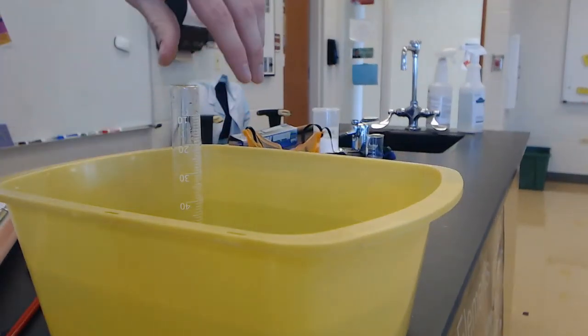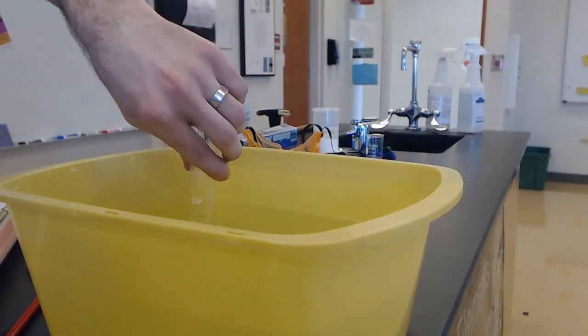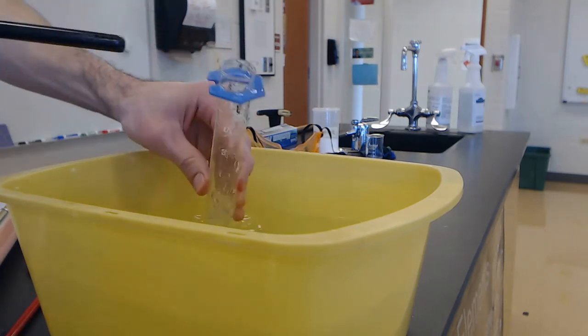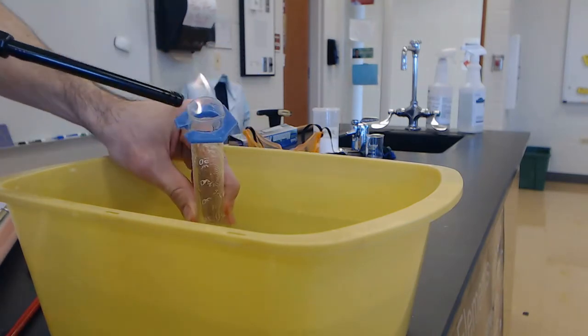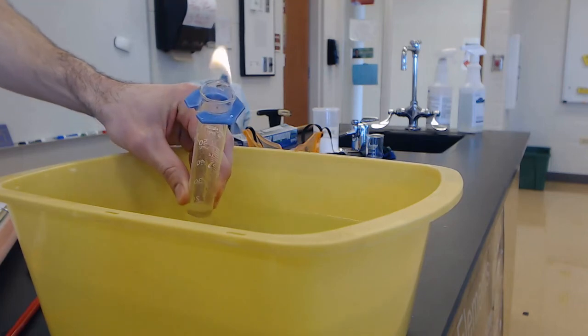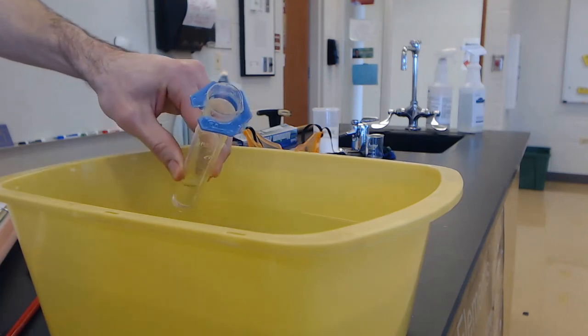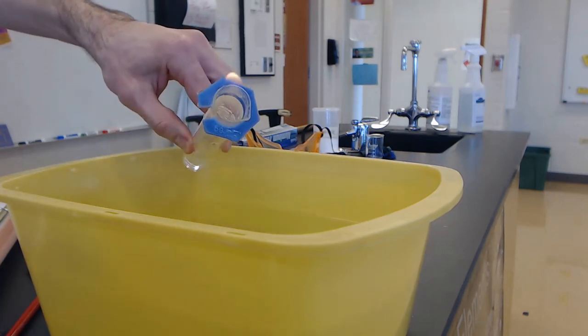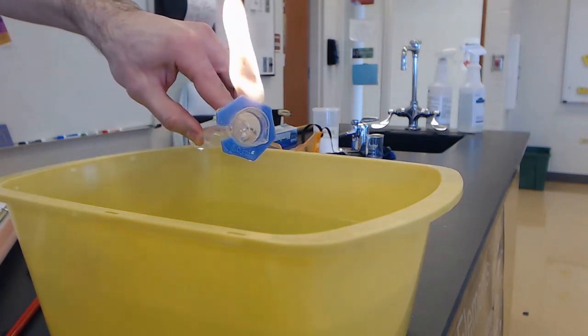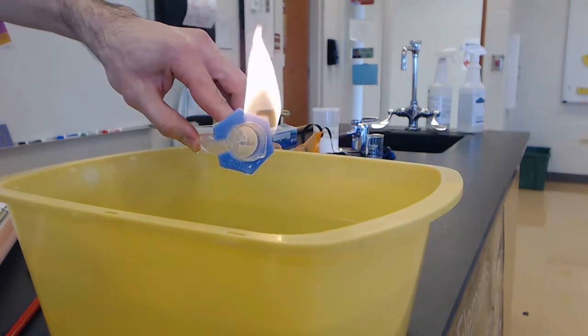You can also light the butane on fire, which is kind of cool. You can actually pour it out too — see that?